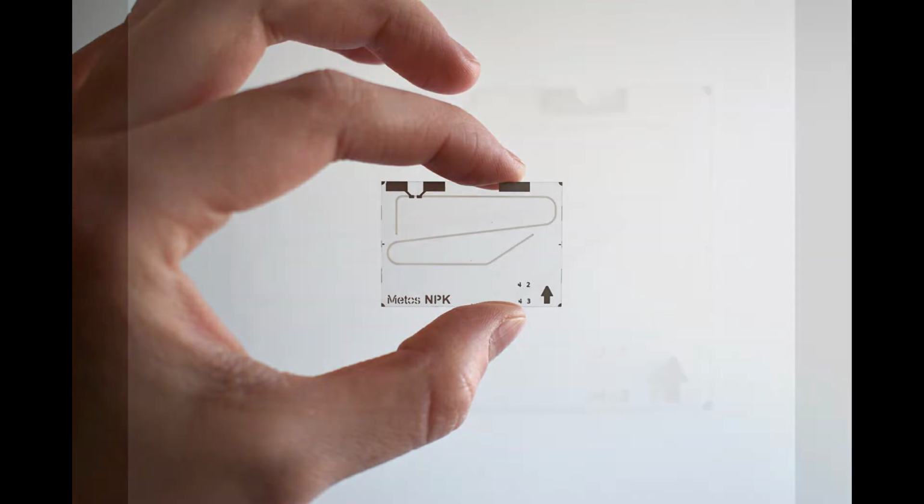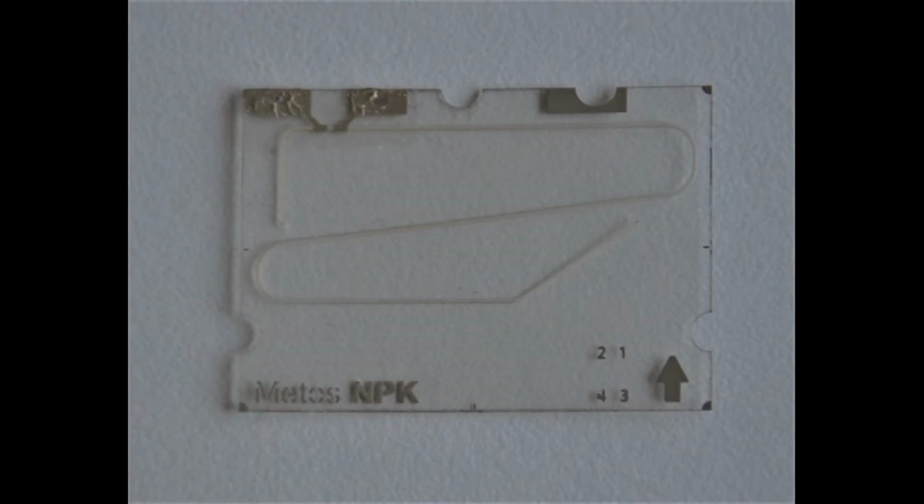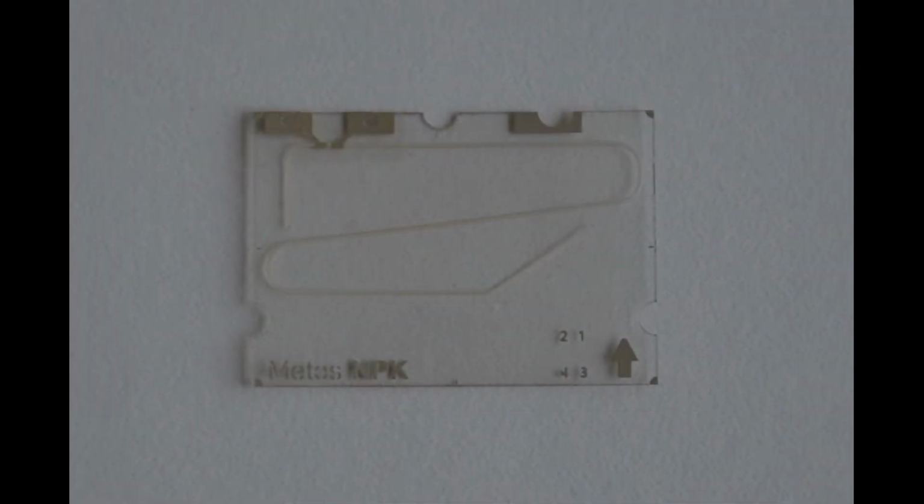There is a conductive grease on the electrodes. Avoid wiping it off because it protects the contact points from oxidation. After the grease is gone, the contacts may turn black within a month and it may no longer be able to connect to the device. So please take care not to touch those two spots.